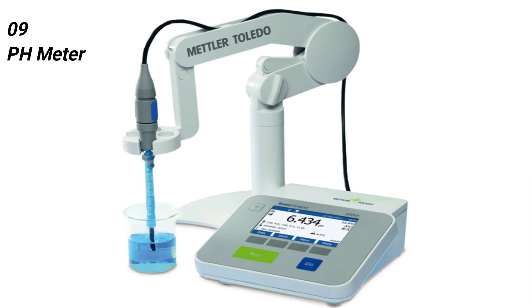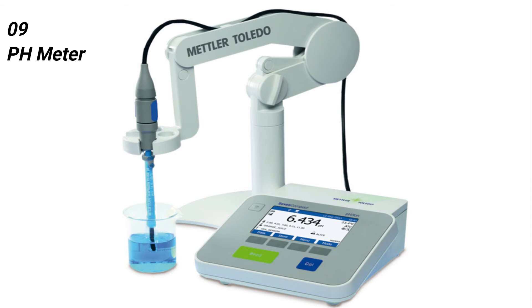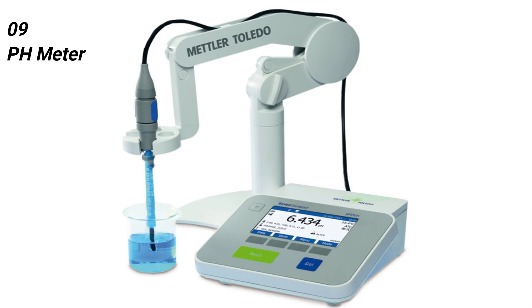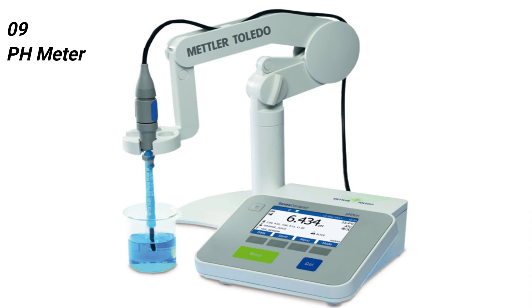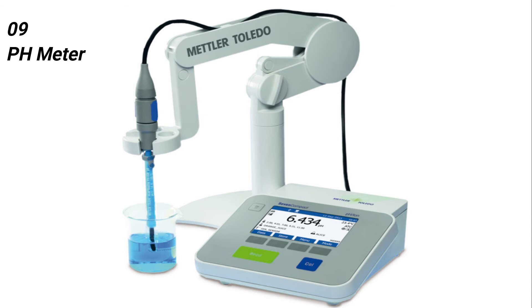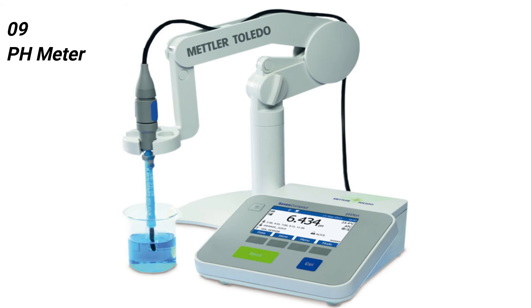Uses: A pH meter is primarily used to measure the acidity of pharmaceutical chemicals, cultures, soil, and water treatment plants. It can also be used to measure the acidity level in wine and cheese during their production.